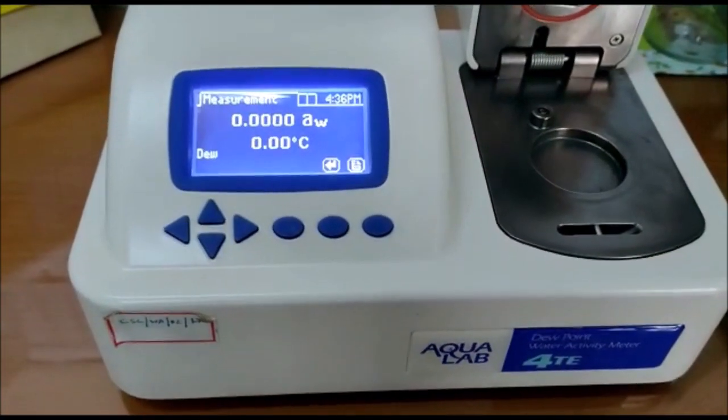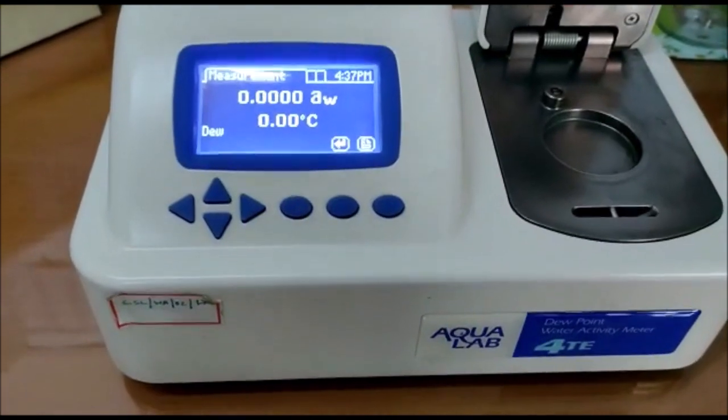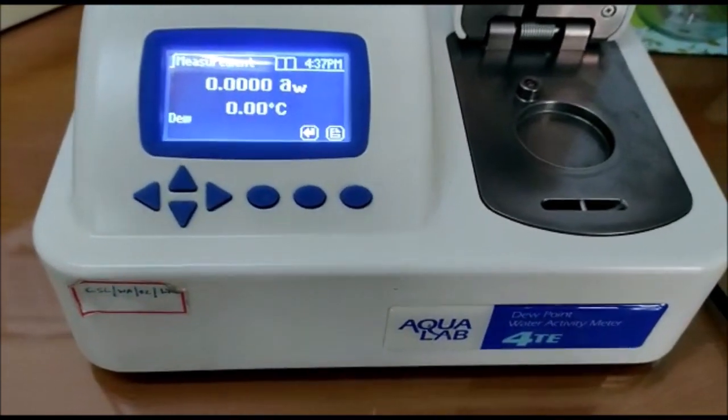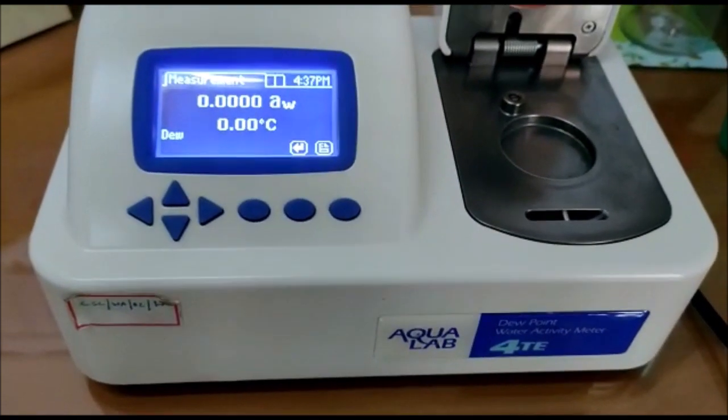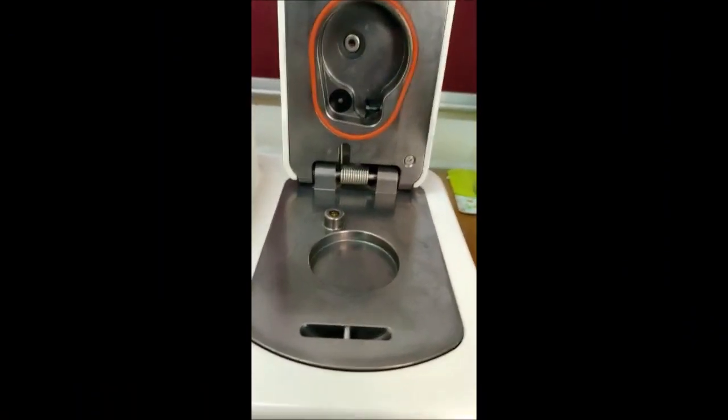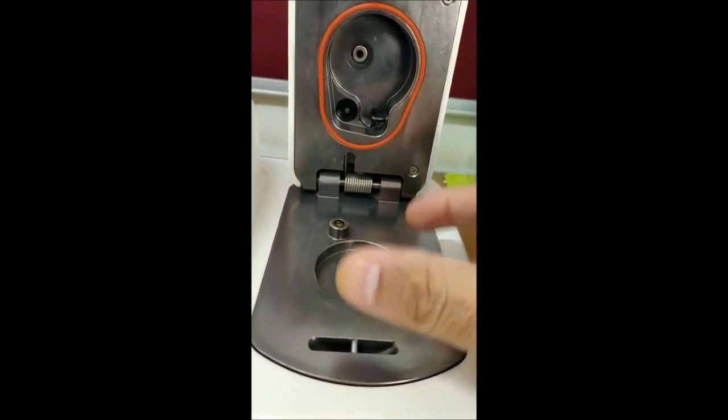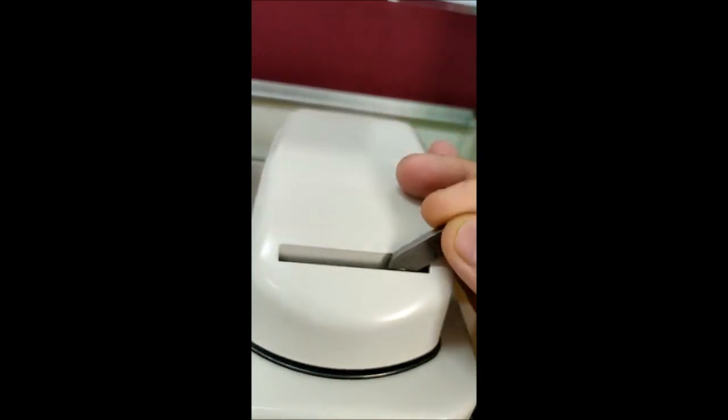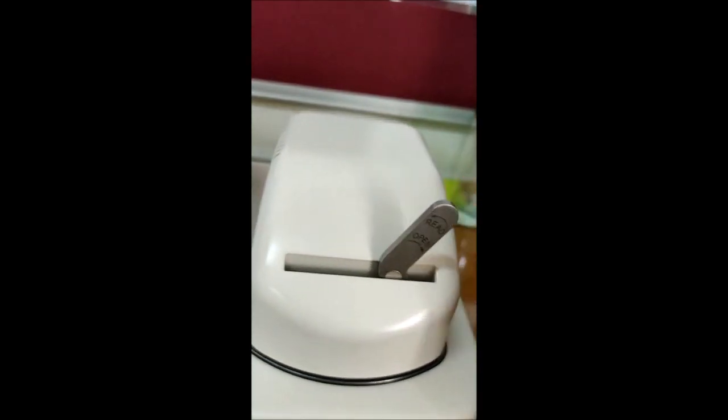Once we switch on the instrument we have to wait for at least 15 to 20 minutes for the warm-up. Till the warm-up is continuing I will show you the components of the machine. This is the bottom chamber where we have to place our sample and then we have to close the chamber and then move this lever to the read position.